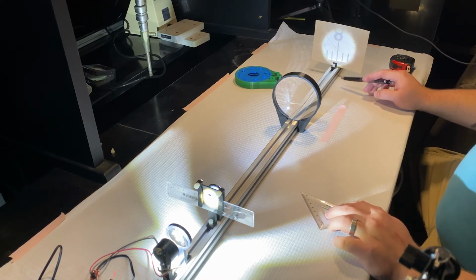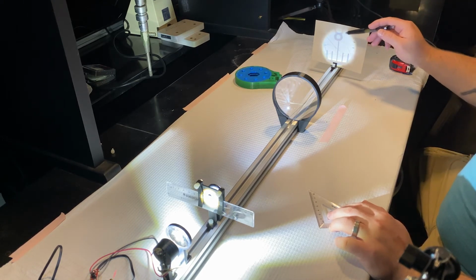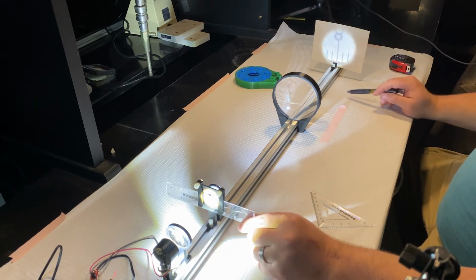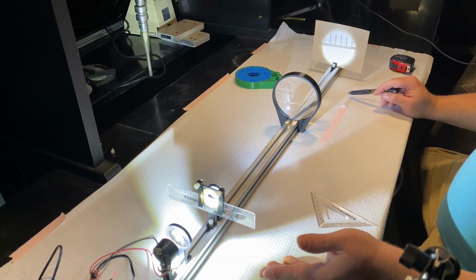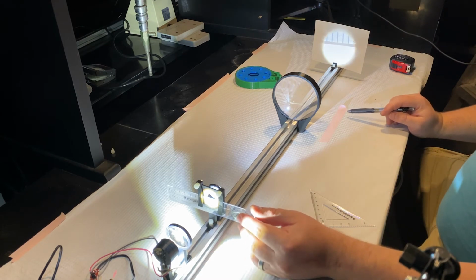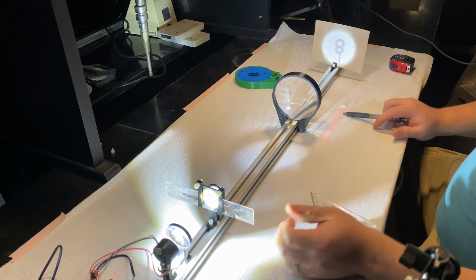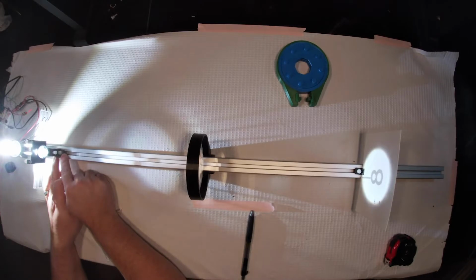Now, let's try to get this 8 more centered in our field of view. So that's a little high. So let me try moving my sample down so that we move this 8 into focus. Oh. So as I move my sample down, my image moved up. So that should tell you something about whether this image is inverted or upright. So I suppose I need to go down to move this guy into focus. All right. So let me play a little bit more with this focusing, getting that 8 nice and sharp.